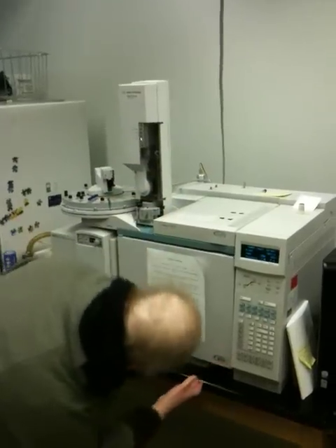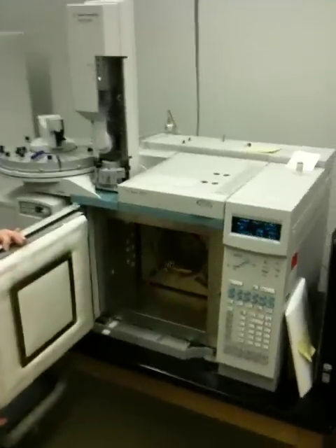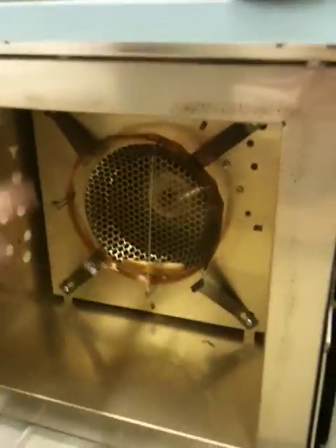This is on film now, so it's going to happen. So I'm opening it very briefly. If you look inside, that very, very, very thin wire is the column. So look at that column compared to your column — it's a lot longer, and it's a lot thinner. One repercussion of that is that you're going to have to shoot in much less sample because it's a very thin column.